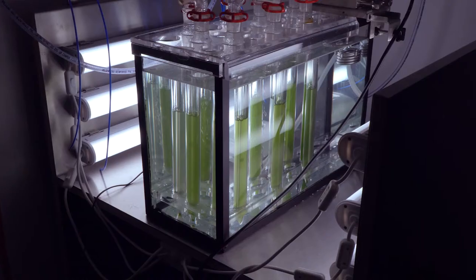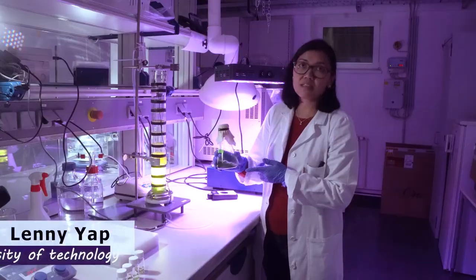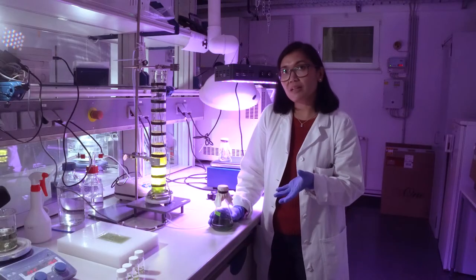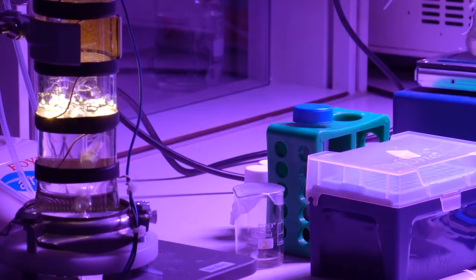We grow the cyanobacteria to an OD of 1 to 2. This is an example of a liquid culture that we have. We check the optical density, and after that we centrifuge, we harvest it, and then the pellet we wash again with the media, and then we concentrate to a certain optical density. And then afterwards, we use it in whole cell biotransformations.